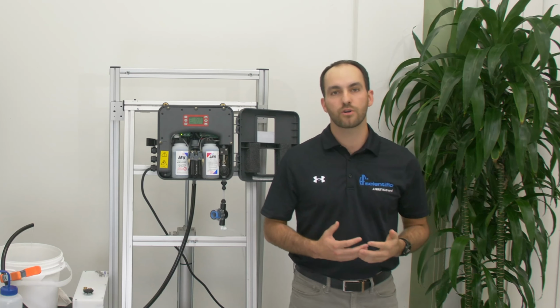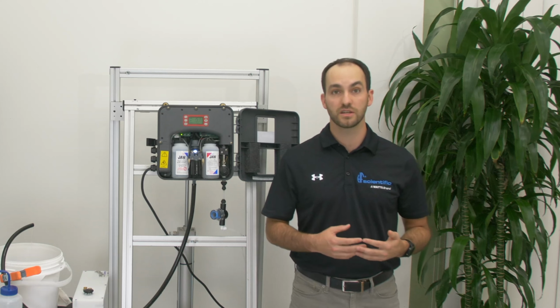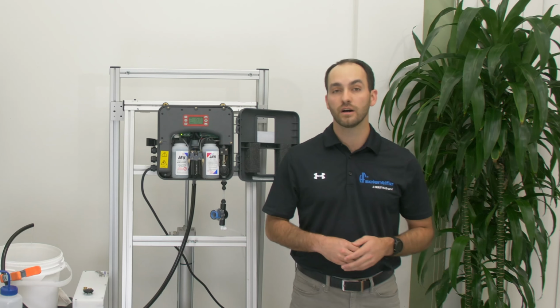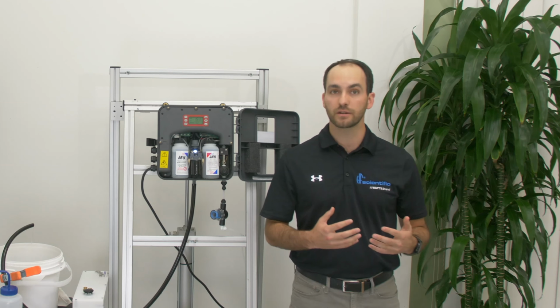If there is not water in the cuvette, you might want to take the cuvette out and ensure there is no moisture on the cell that is causing the error to come up. Clean and dry off the cuvette. Also make sure to dry off the inside of the optical block with a lint-free cloth. Any water inside there will cause some interference and give you a false reading.